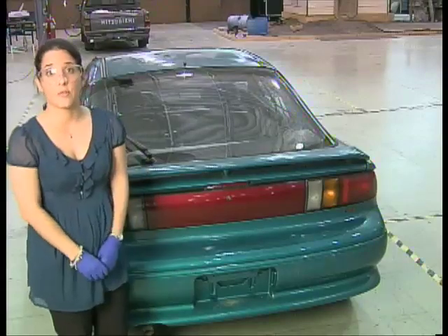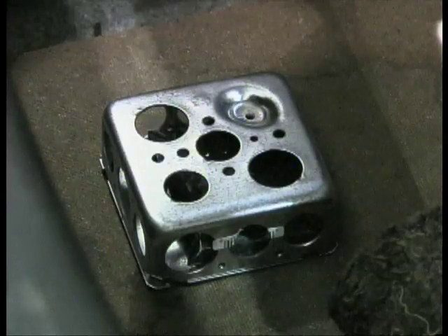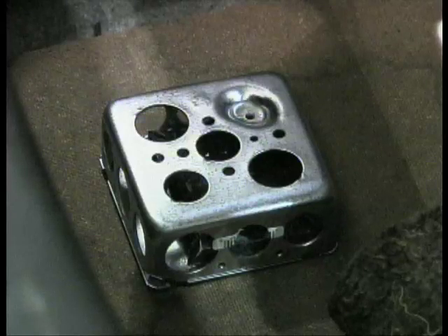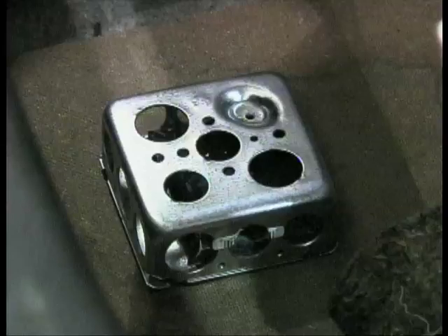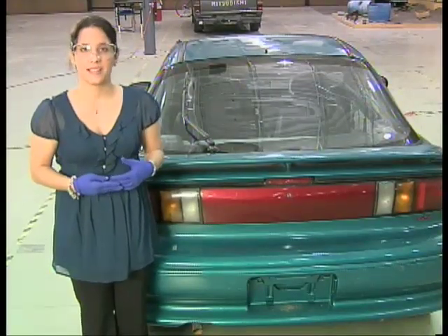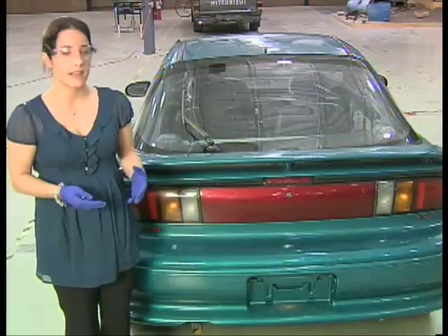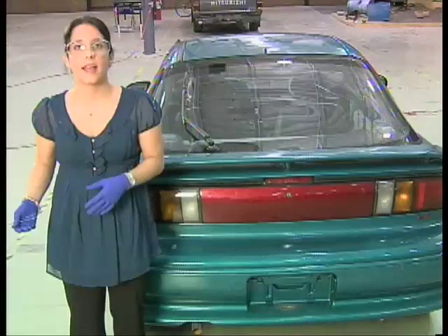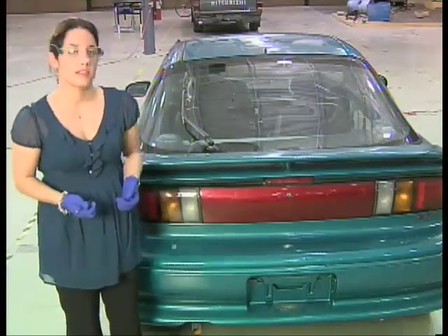The trunk is also a good place to sample for particles. This vehicle contains an electrical box with holes cut out, and inside that box we have a plastic bag containing smokeless powder. There are two containers: one tightly sealed plastic bag within an electrical box. Two such electrical boxes contain smokeless powders, to illustrate that you can sample the head space of a larger volume area, and the PSPME device would absorb these vapors.